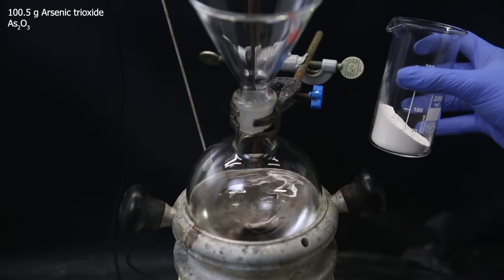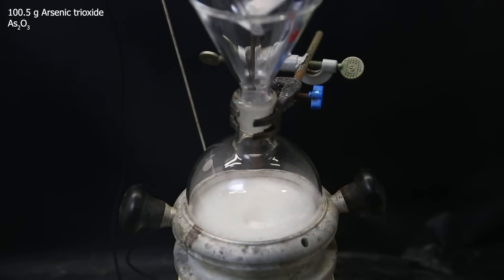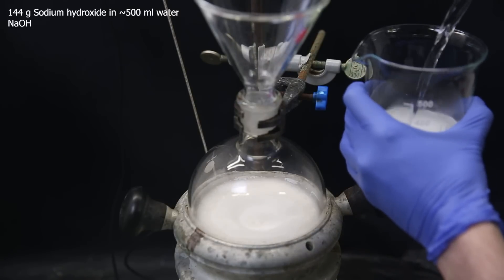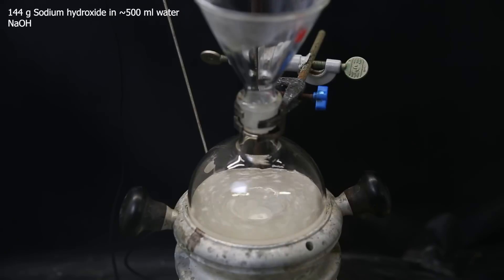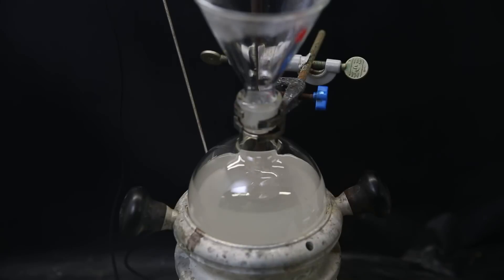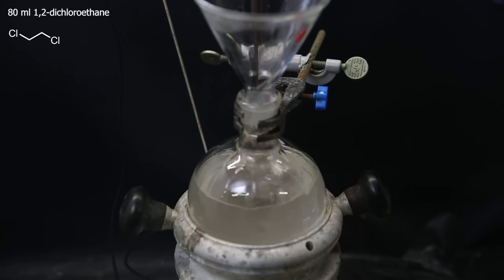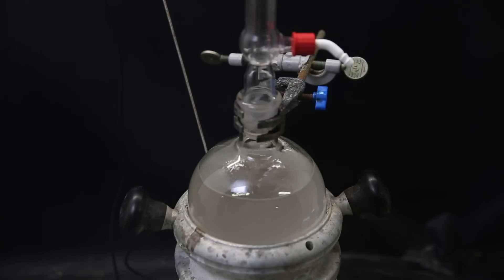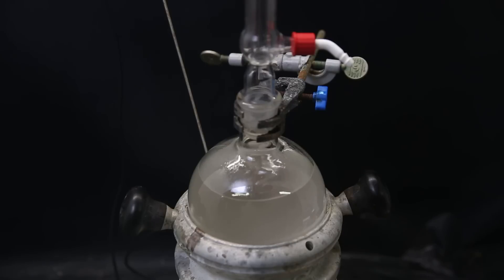As a reagent, I add in 100.5 grams of arsenic trioxide. I then weigh out 144 grams of sodium hydroxide and dissolve it in 500 ml of water. I add all of the solution to the flask, and it starts to react immediately with the arsenic trioxide to form soluble sodium orthoarsenite. To that, I gradually add 80 ml of 1,2-dichloroethane, attach a condenser without running water just to minimize losses from evaporation, and leave this to stir at 60°C for two days.